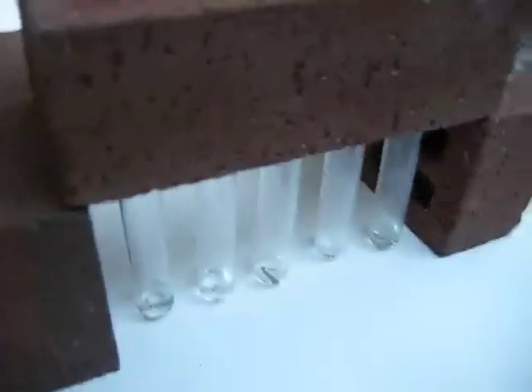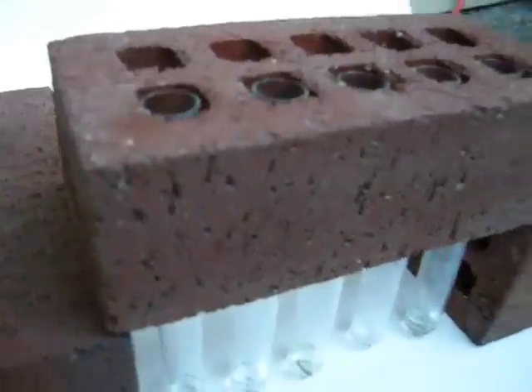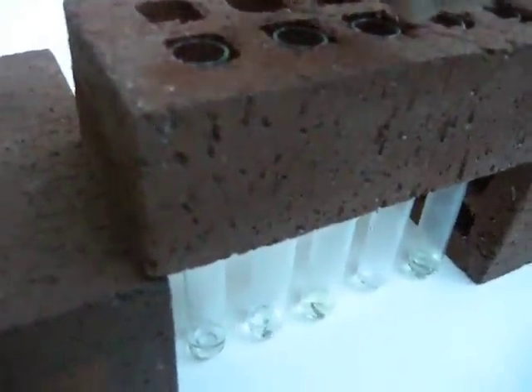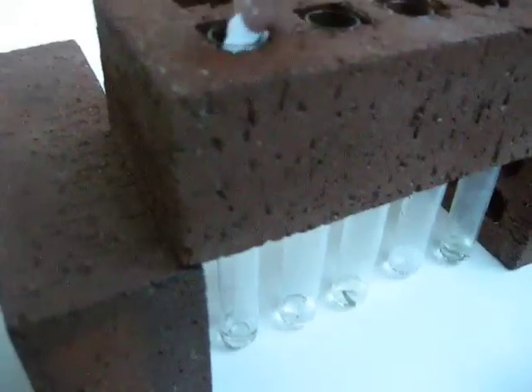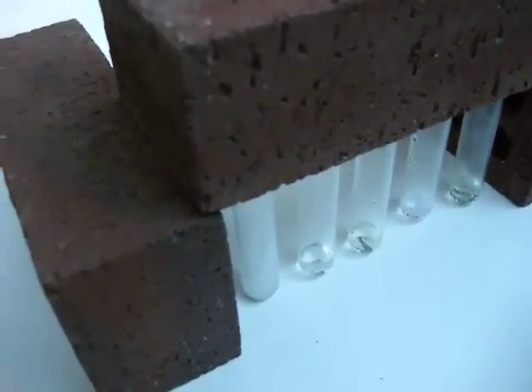You really don't want to touch it with your hands, because it will make you itch like crazy — it's burning your skin off. It will make that fizzy sound, and you just want to keep adding more baking soda until it's done fizzing.